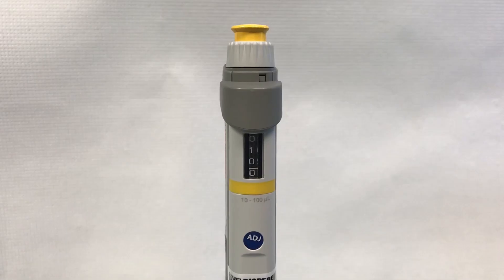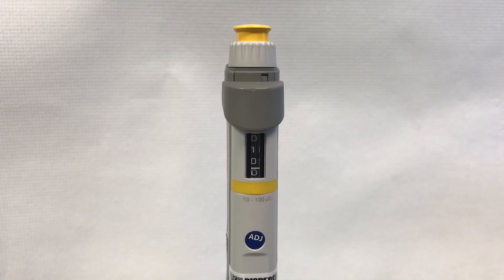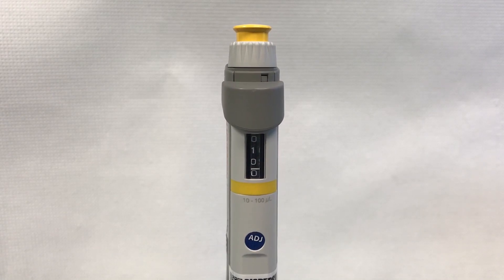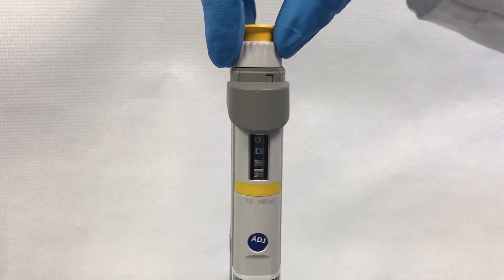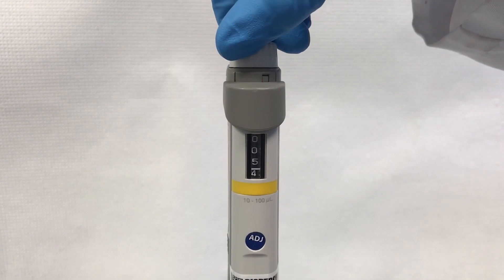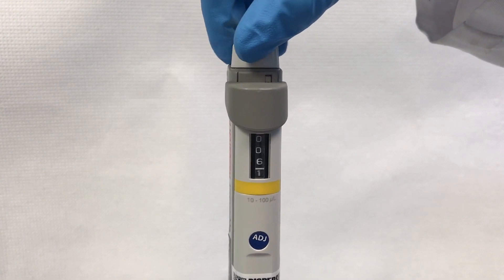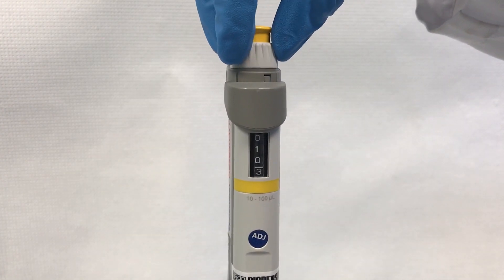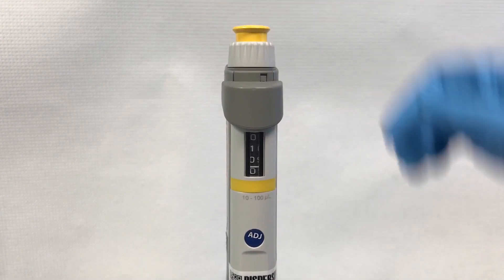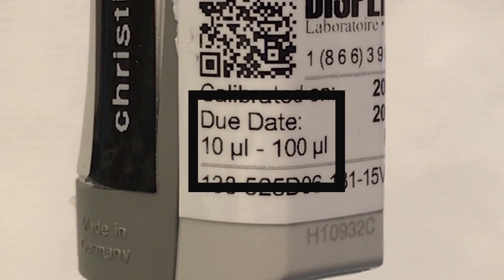To set the desired volume, turn the volume adjustment knob clockwise to decrease the volume or counterclockwise to increase the volume, making sure it does not exceed the pipettable volume that is shown as a range on the pipette or label.